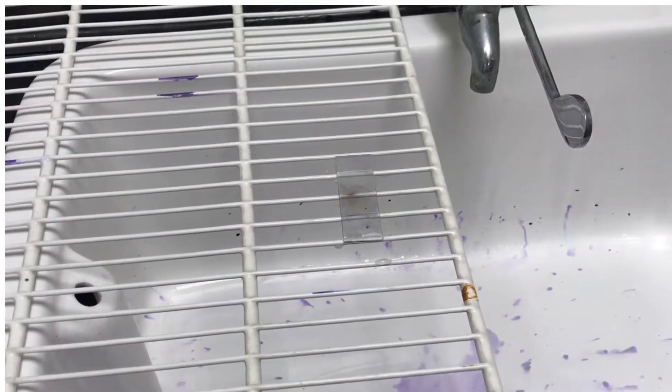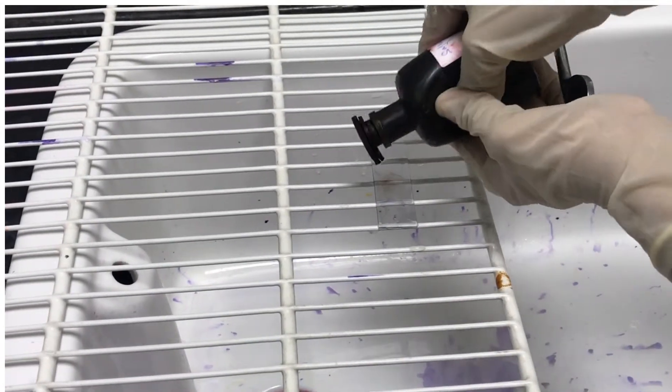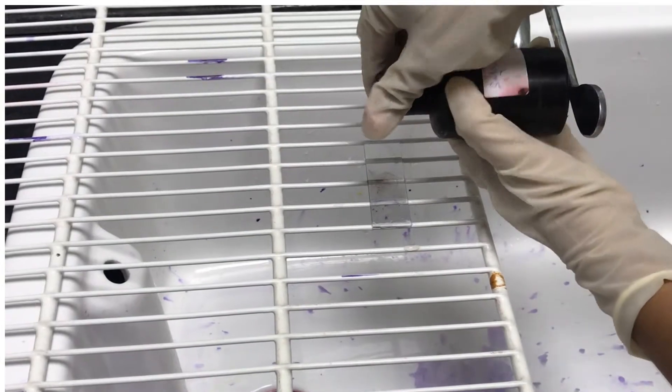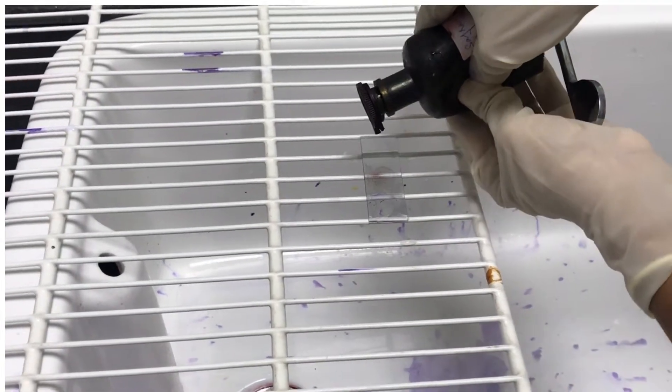Finally, flood the smear with safranin to counter-stain it and let it stand for a minute.